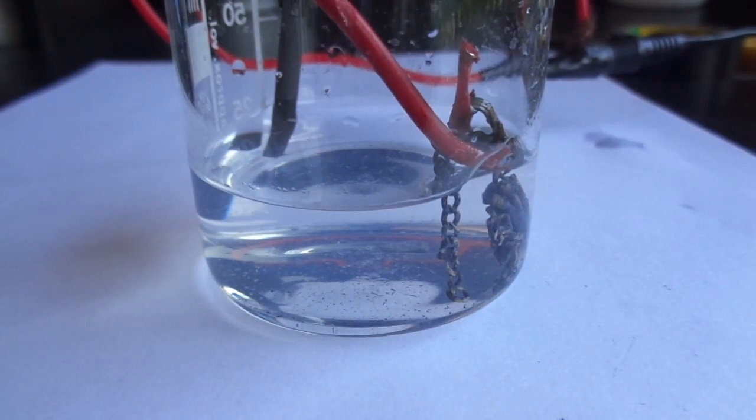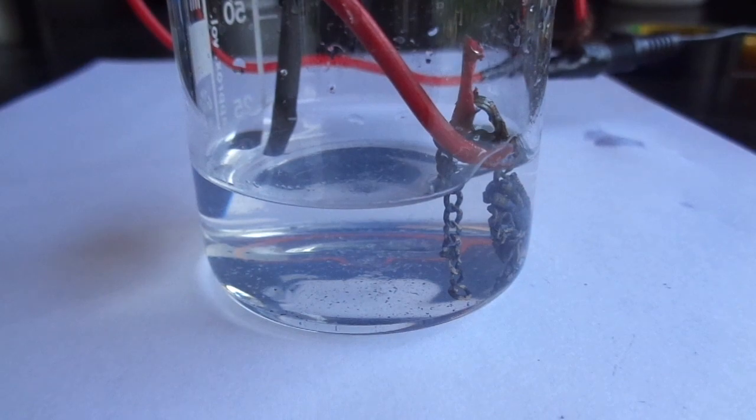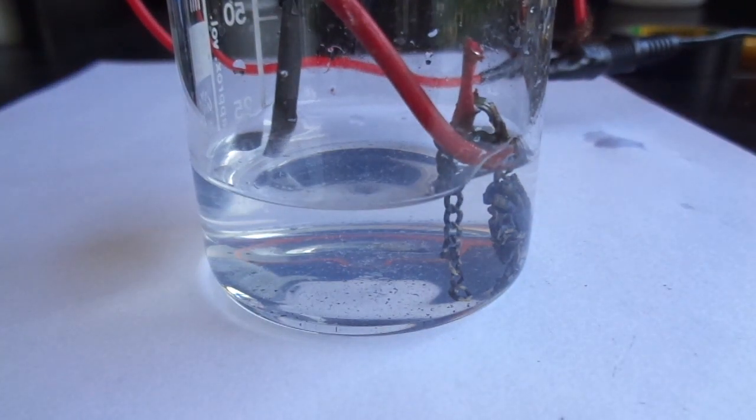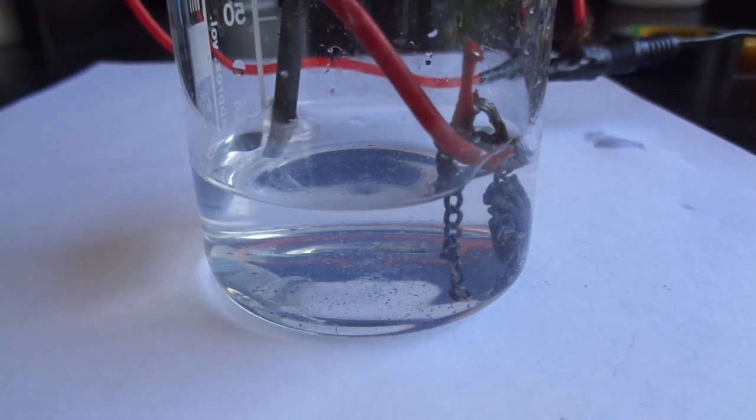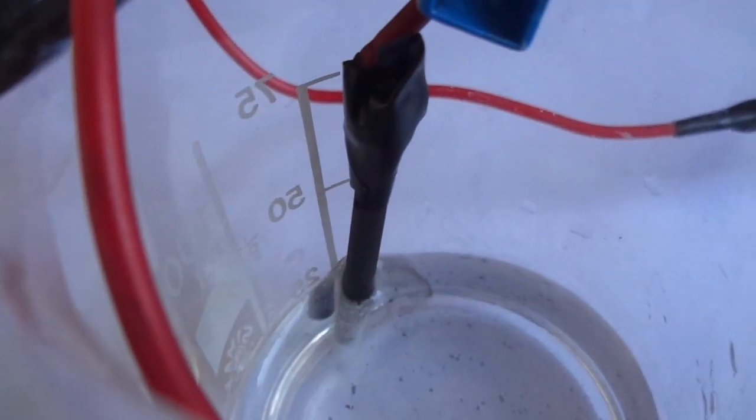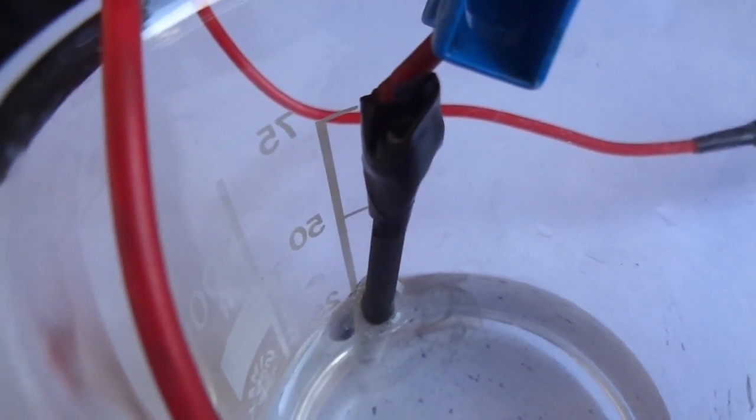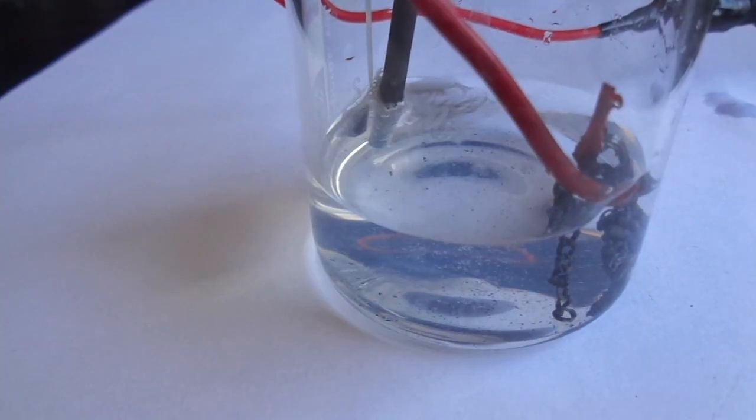You can definitely see that on our cathode there is hydrogen generated.